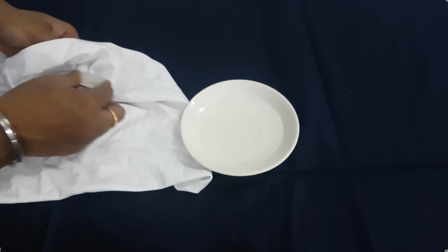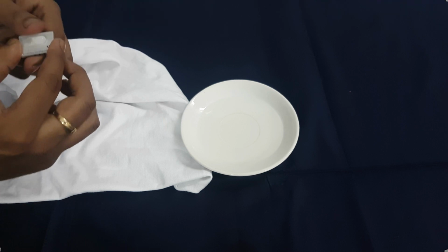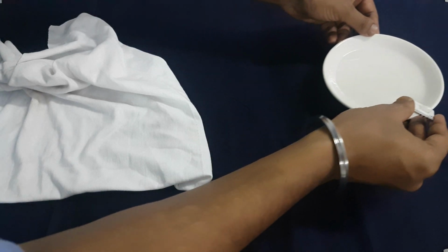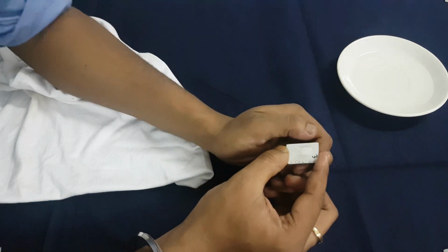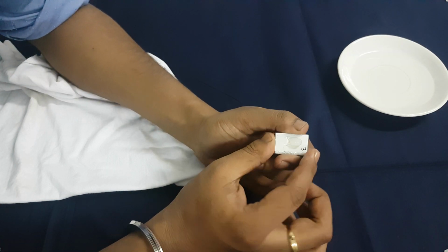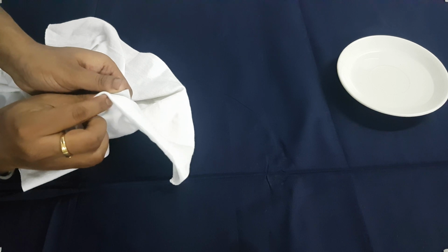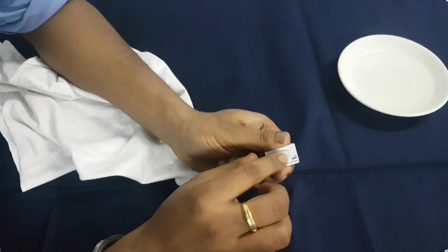But yes, I'm cleaning it now. The oil part must be removed, right? So let's keep it aside for a bit over there. It's visible to you, right? Good. So let's talk about this part now. As you could see, it's still there. Okay, just a minute. Yeah, so it's still there, as you could see.